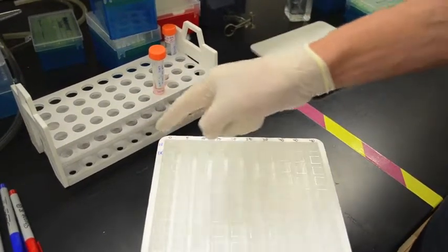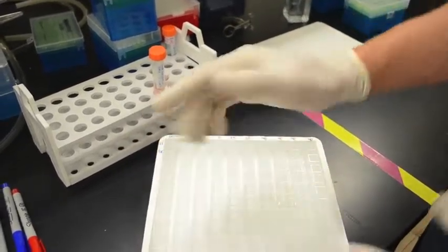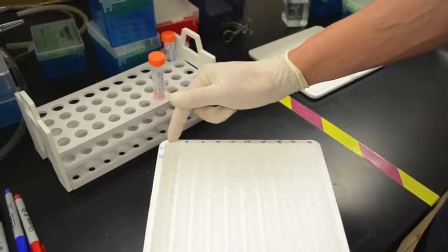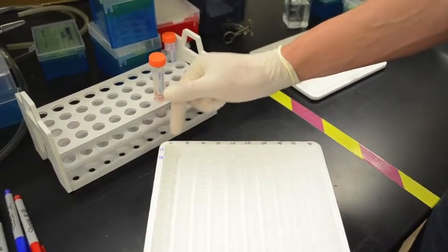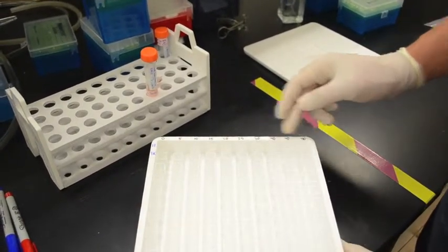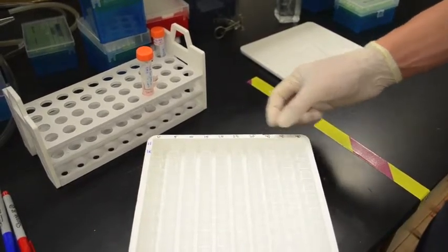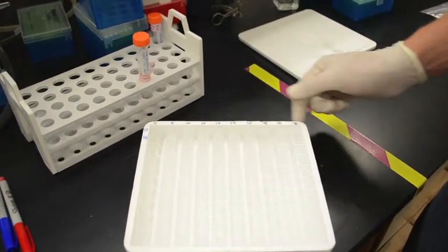When I do a real experiment, I measure multiple different enzyme substrates to look at different enzymes. So we'll have substrate 2 live, substrate 2 killed, substrate 3 live, substrate 3 killed, etc. Then across the top, I've written the different volumes of substrates I add, and we can do a conversion later on to calculate the concentration of the enzyme substrate given the volume I added. But this is volumes in microliters. It's 0, 5, 10, 15, 20, 25, 30, and then I've done 3 times 40 because I want to have replicate measurements for the highest concentration. So I have 3 cuvettes where I'm measuring a volume of 40 microliters of the substrate.